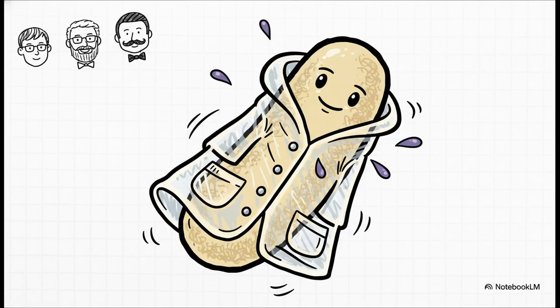And the secret to this superpower? It's actually pretty cool. These bacteria have a cell wall that's just packed with this waxy stuff called mycolic acid. Think of it like a thick, waterproof raincoat. It makes their cell wall almost impossible for normal stains to penetrate. Now, a little history for you. Paul Ehrlich was the first to notice this, but it was actually Ziehl and Neelsen who came along and perfected the staining technique that we're still using today.